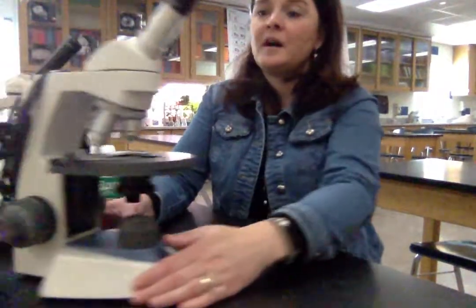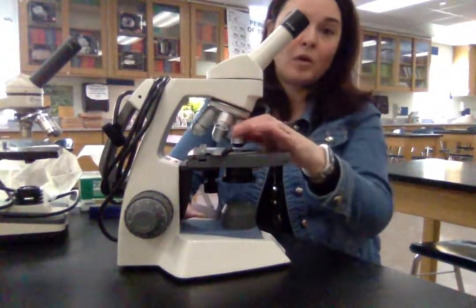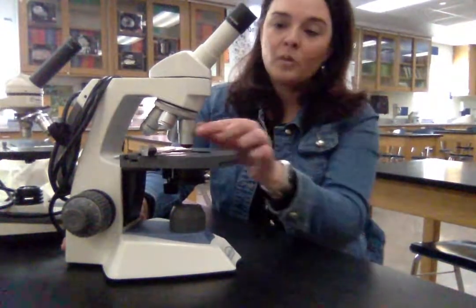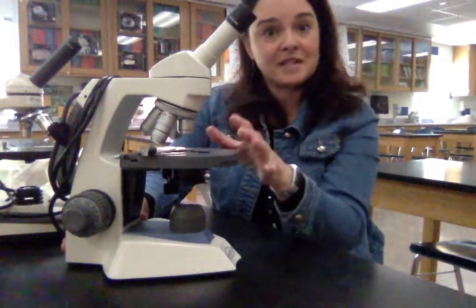The nosepiece is this rotating area that holds all the different objectives. One of the things I do when troubleshooting with students who say everything's black and they can't see anything — the first thing I do is turn the nosepiece to make sure it's clicked into place. If it's not clicked into place, there won't be any light passing through the lenses.